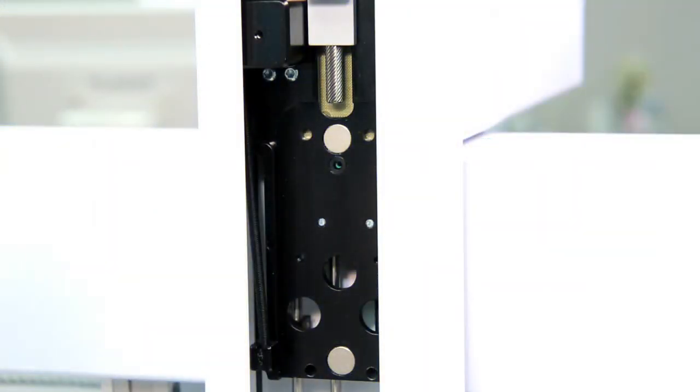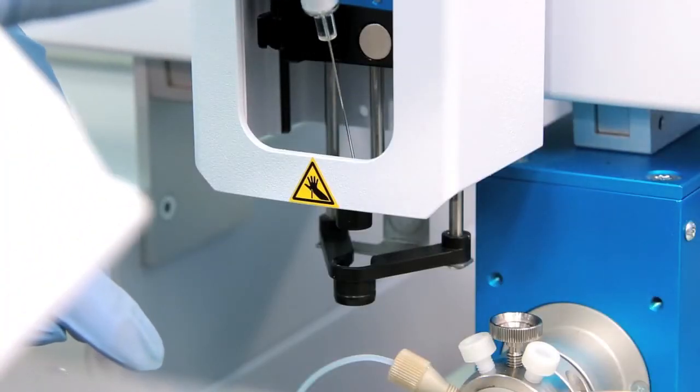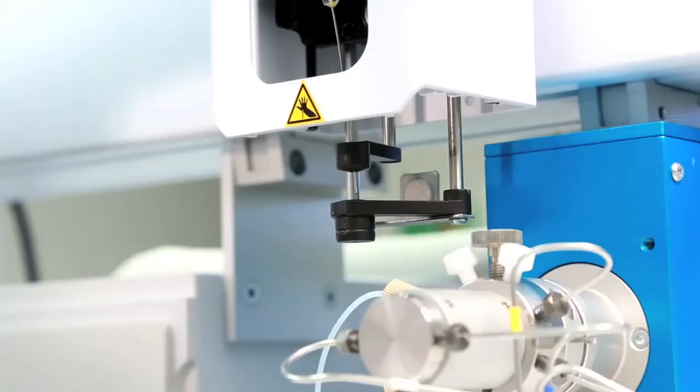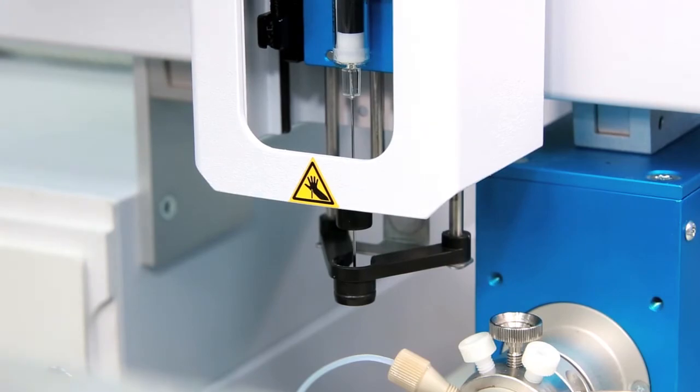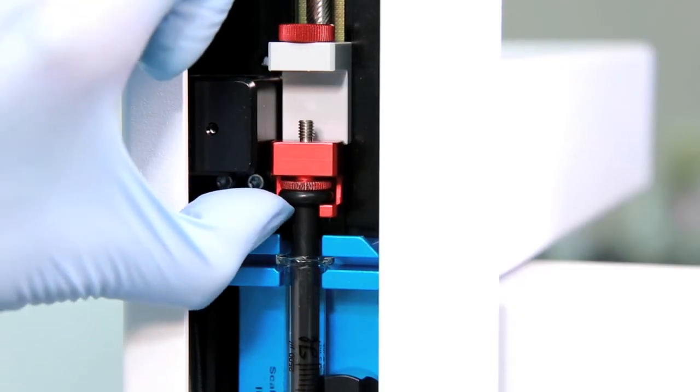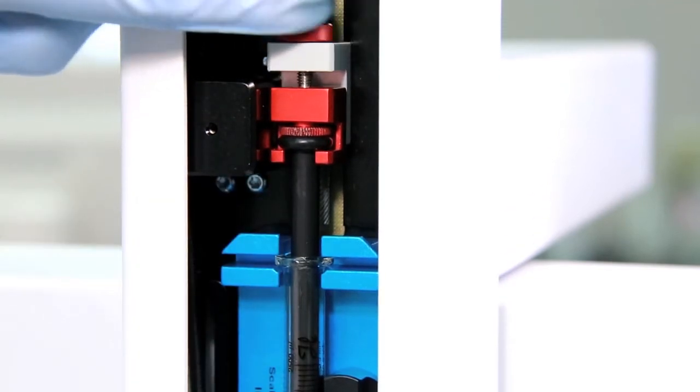To insert the syringe assembly, enter it at an angle, guide the needle through the upper guide and then the lower and it will snap into place by the magnets. Finally lift up the plunger and tighten the retaining nut at the top.